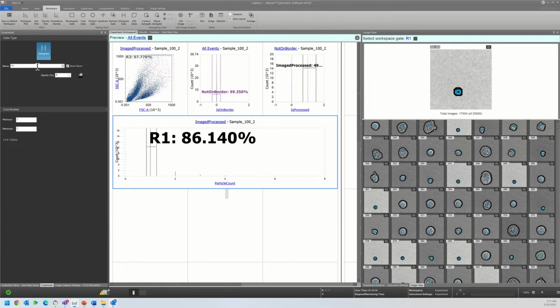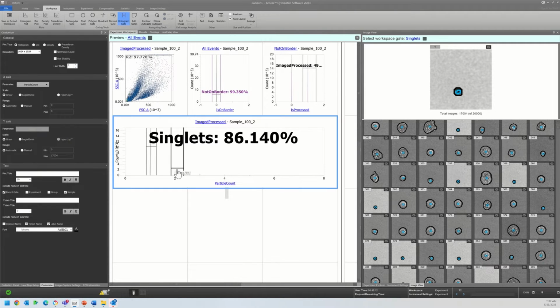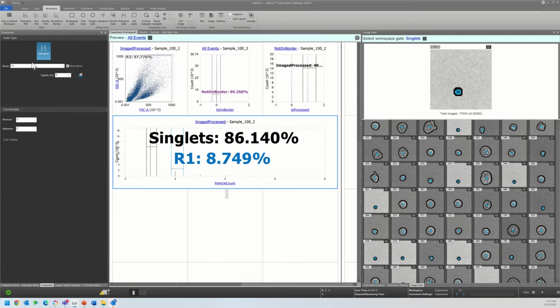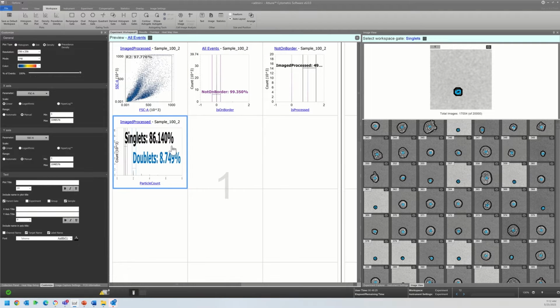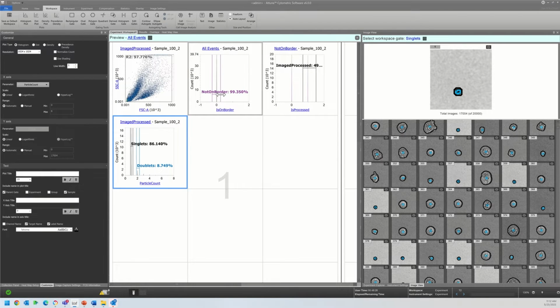And we're just going to have our singlets, but I'm also going to set a doublet gate because some of the parameters we'll look at are very useful for anything that is a doublet. And so at this stage, I have excluded any events that were not fully imaged, so any events off the border of the image. I've only included processed images in my subsequent analysis steps, and I've also done my singlet and my doublet gating.